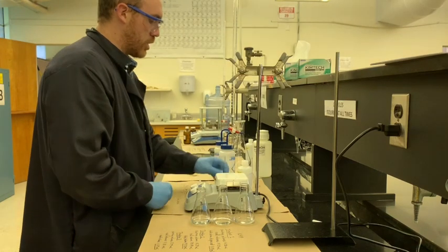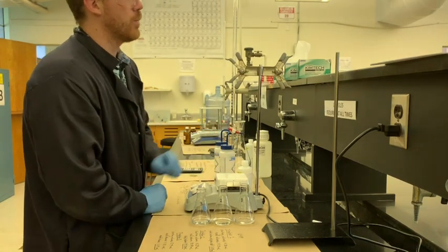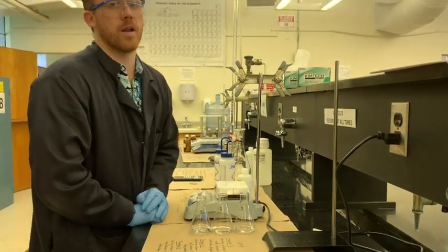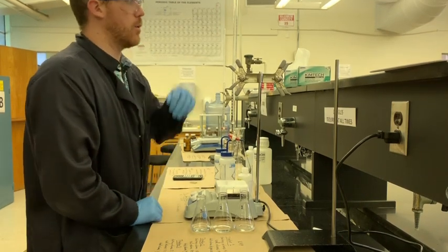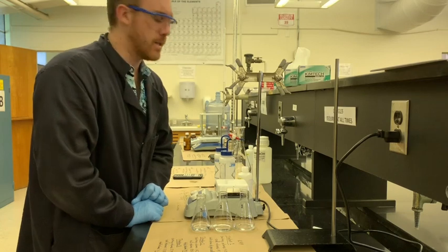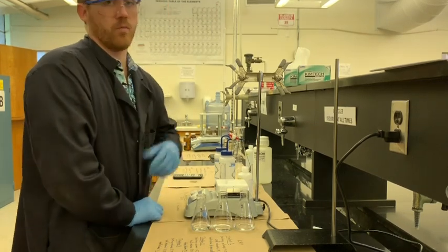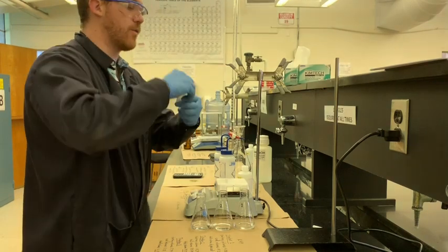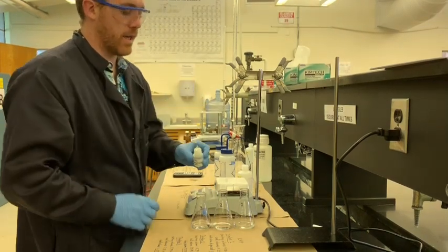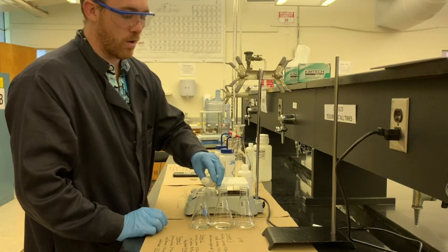Next, before the titration, I'm going to check to make sure there's no bubble. I actually didn't change the burette at all between these titrations and the ones of the KHP, so it's just like we left it, including the final volume, but we'll re-record that in a second. And I'm going to add a little bit of this phenolphthalein just to get us some indicator concentration in each of these while we're at it.